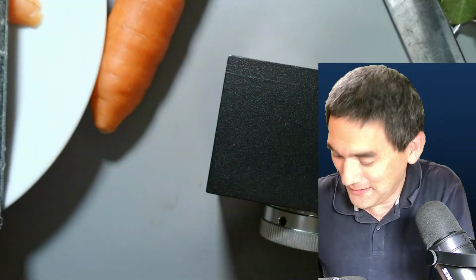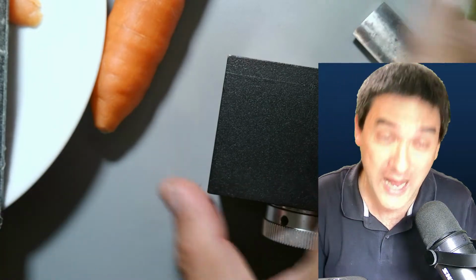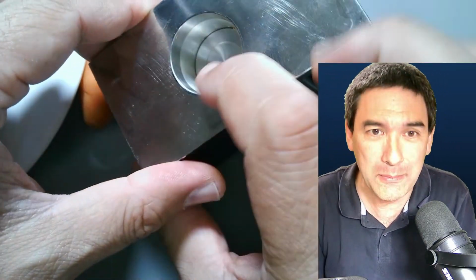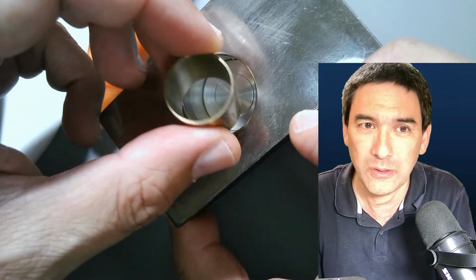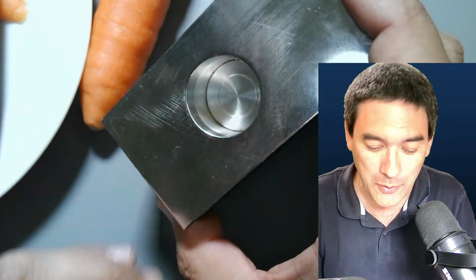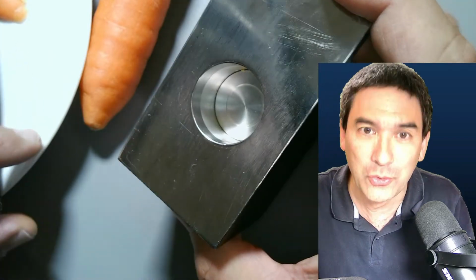Okay, and if anyone from the company is watching this, and maybe I'm going to send them a link to this video, I really like the microtome, but there could be one tiny little thing that would really enhance it if you were also able to include some kind of a tool like this that would help you punch out the carrots. That would be quite nice, but if not, it's also fine. I've also managed to do it without. It only takes a little bit more time.